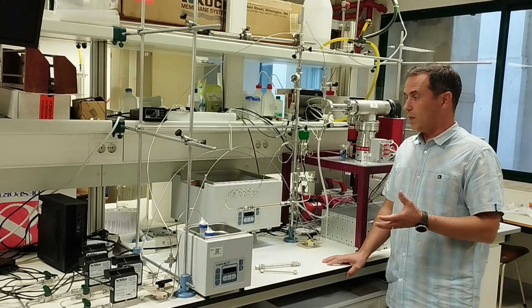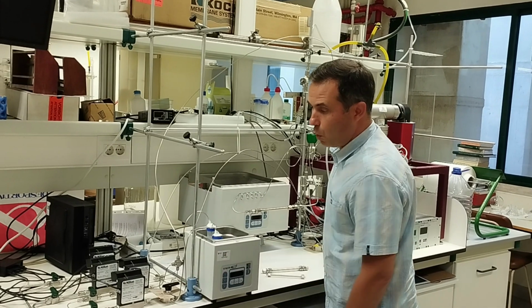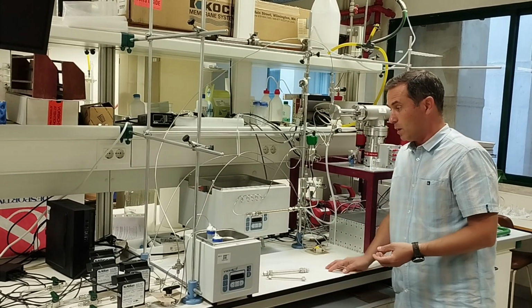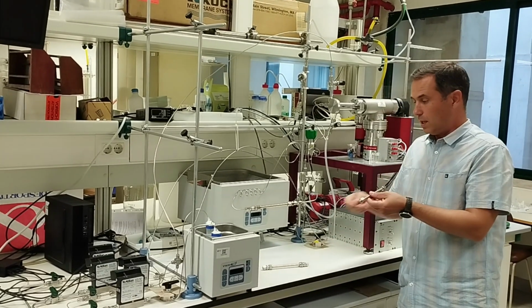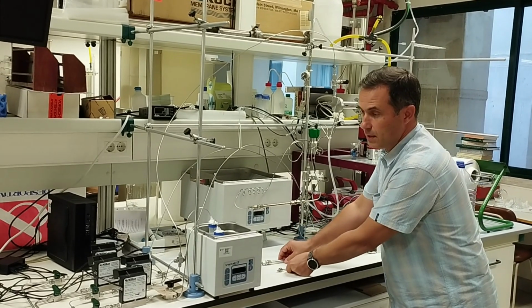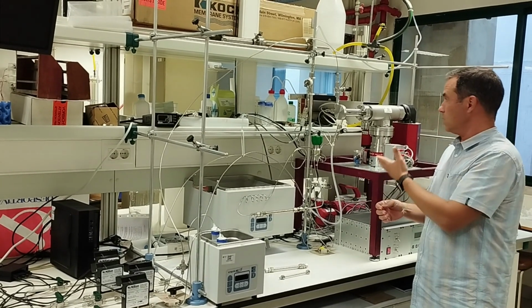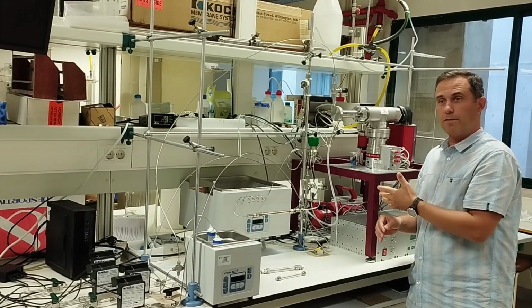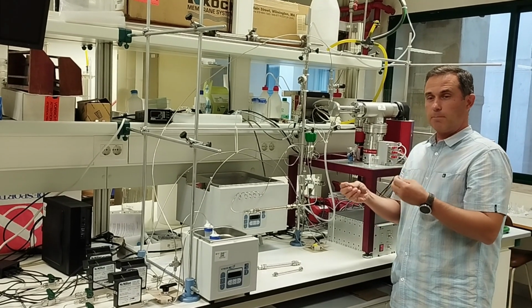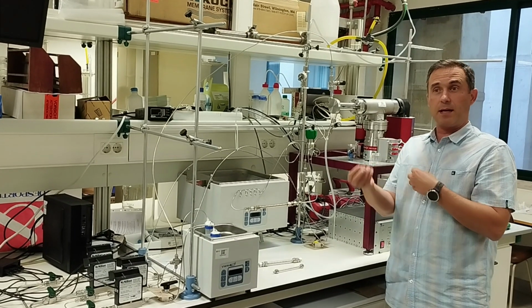In this laboratory, we can continue to assess different adsorbent materials, but using a different technique. In this case, using mass flow meters, we can make mixtures of different gases that afterwards can pass through materials that we can put in different columns, and the materials are separated through this, and we can measure the concentration at the outlet of the column, in this case with the mass spectrometer. This is important because we can see how the materials perform for the separation of gases.